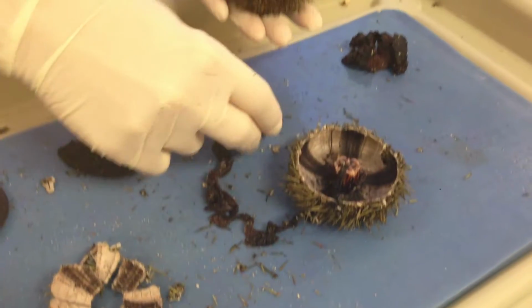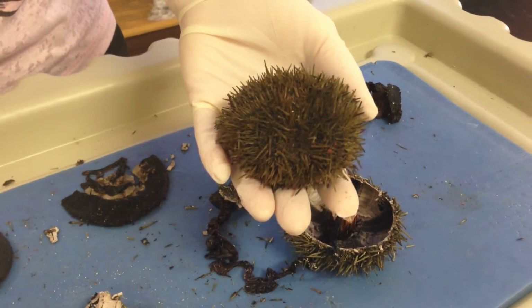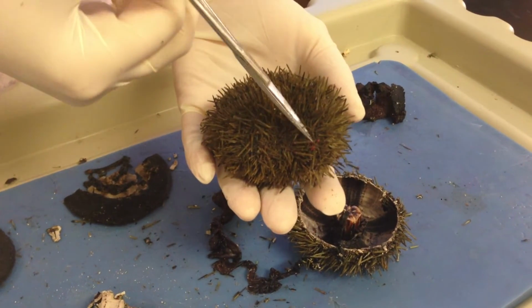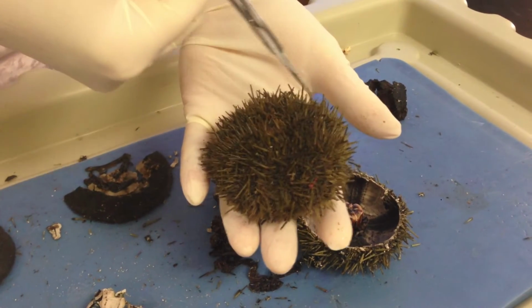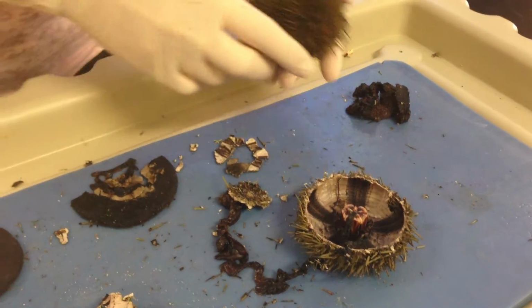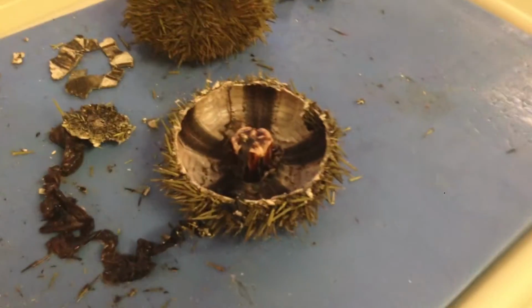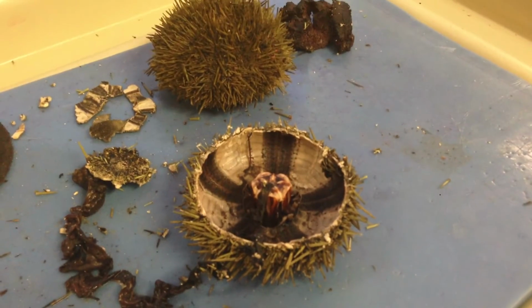Then after I created that small circle around this area, I took my scissors and went down the sides and then around the center. So I essentially took off a sphere. And once I was done taking the sphere off, you can see this half of the sphere as well as the top half of the sphere, which is going to look like that. You guys understand the difference there?